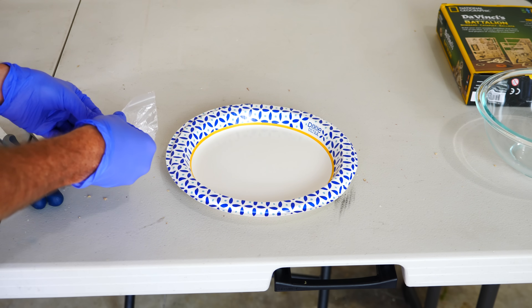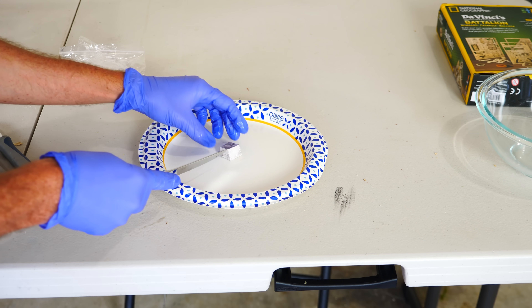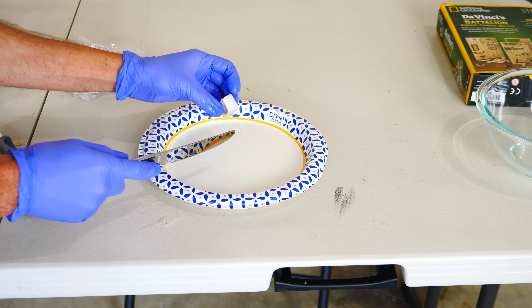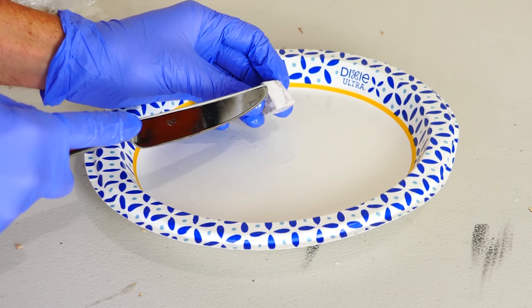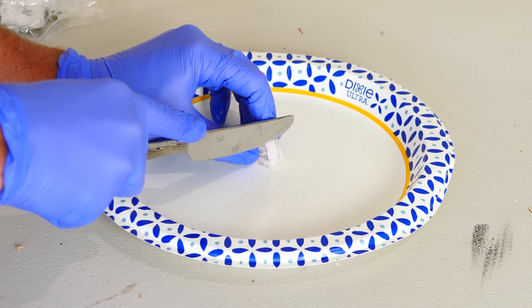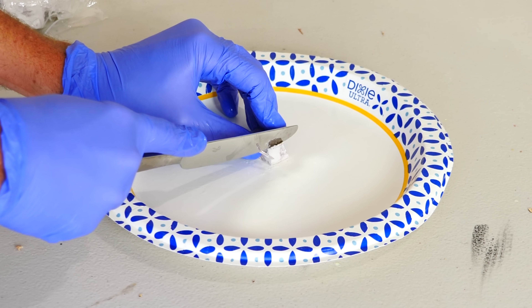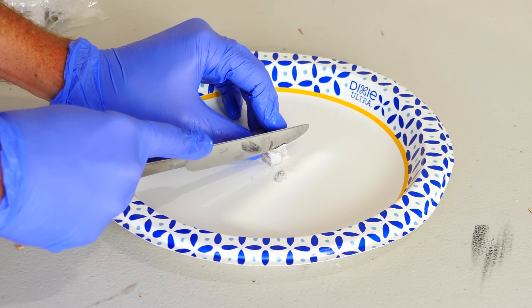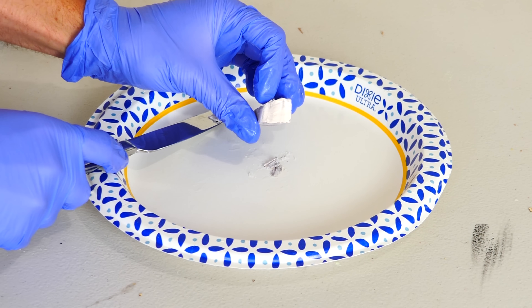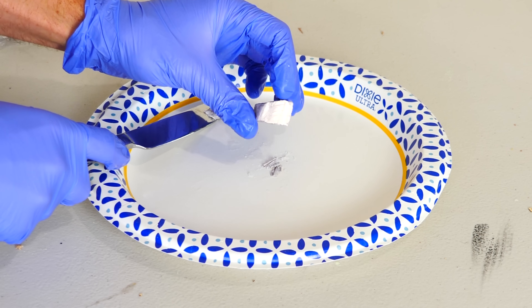Okay, first let's get some sodium. Here's our chunk of sodium — you can see that it doesn't look that shiny. That's because it's created some sodium hydroxide salt on the surface because it's had a slow reaction with some water. You can see that when you cut it, it gets shiny again, but then it quickly oxidizes when it reacts with the water in the air.